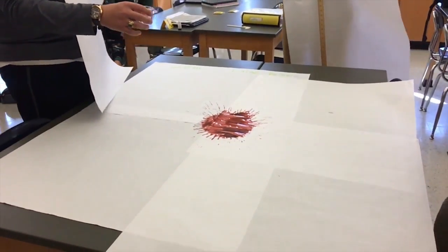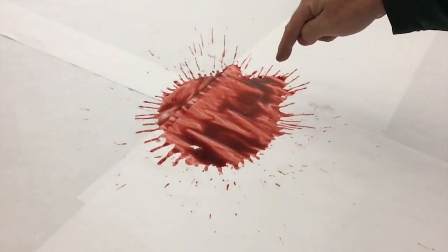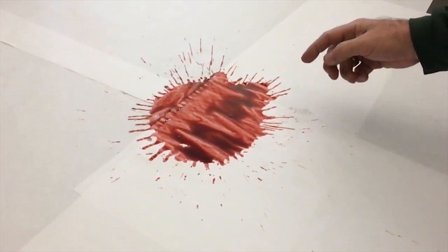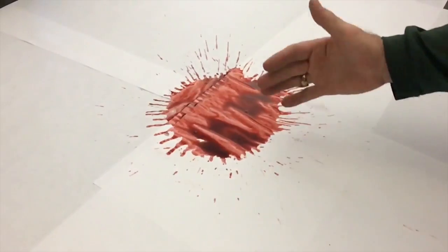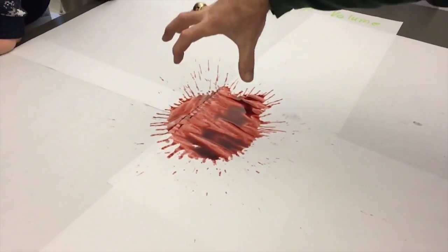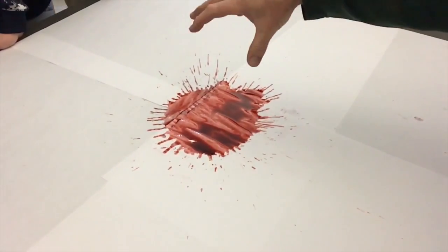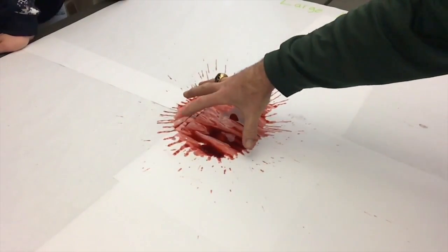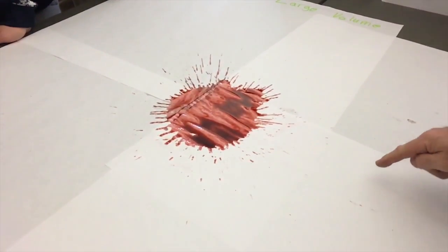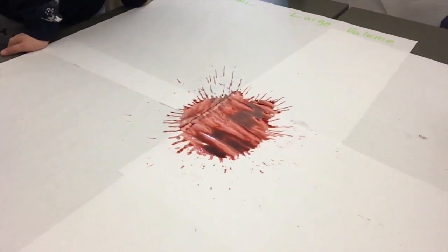We have the parent drop and we have the target surface. You can see the spines. When Carlos dropped it, he placed it in one spot, so all of that blood landing in one spot — the volume — caused the coronal effect, where the blood came up and then worked its way out. Now we see a lot of drops that are displaced from the parent drop.